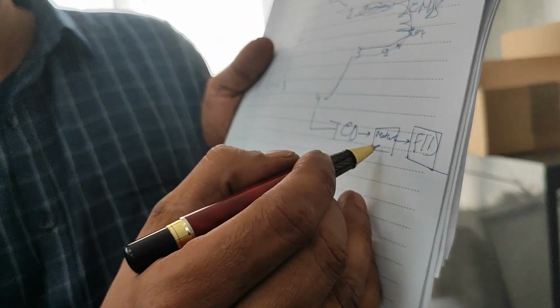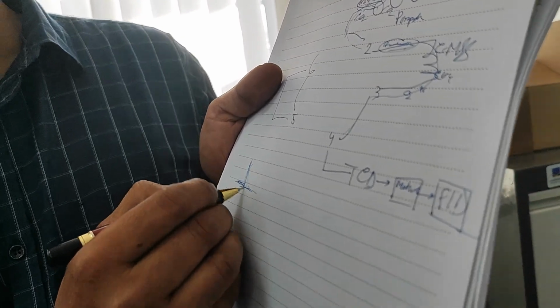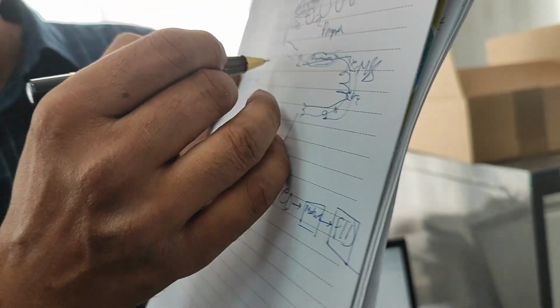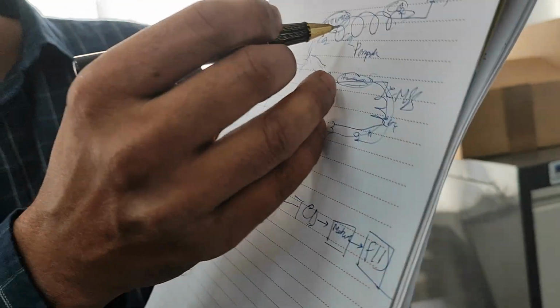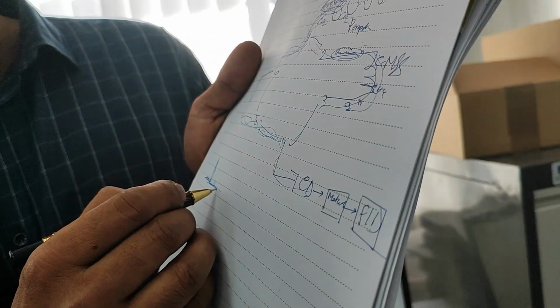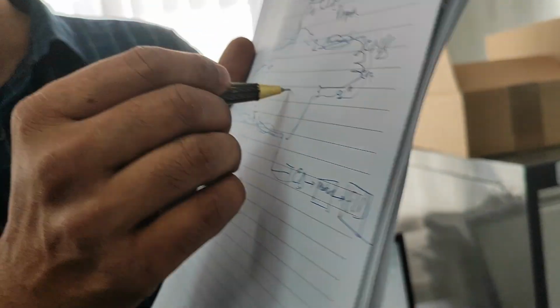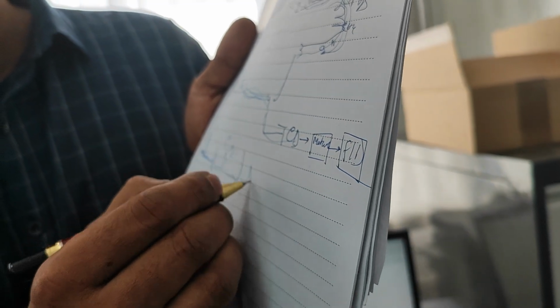So we can get the hydrogen peak at the first event. All other peaks will be trapped. CO2 can be pushed from here, and you can get the CO2 peak, hydrogen, CO2. After CO2, you can switch off the valve, and these 4 peaks can be eluted one by one.